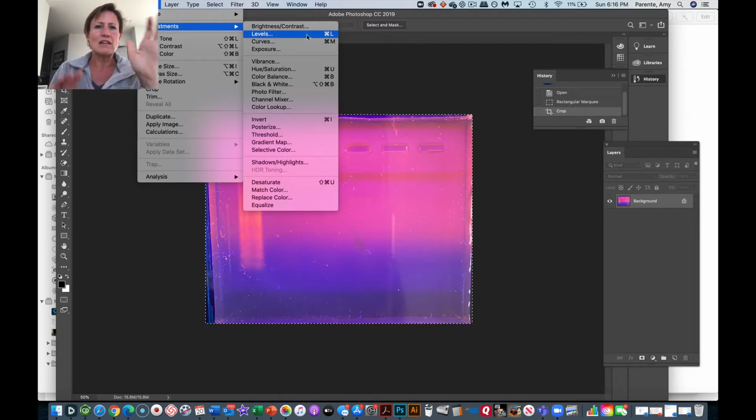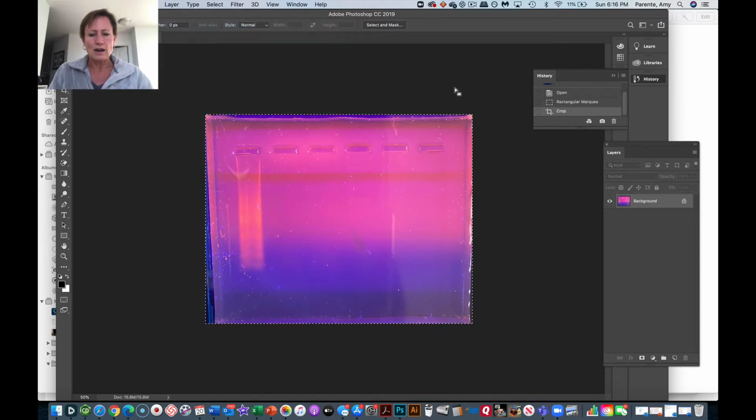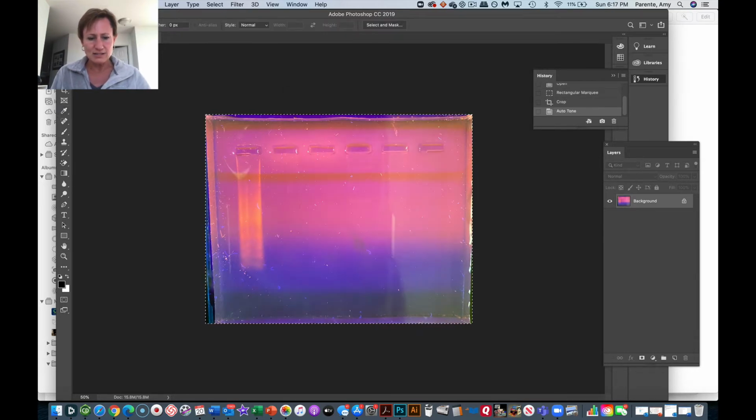I want to make sure that the levels are balanced, so I'm going to let the program do it itself. Then I'm going to desaturate it, so I want to make it into a black and white image. And then I'm going to invert it because I want my bands to be dark against a light background. And so that's what fixing the levels does there.